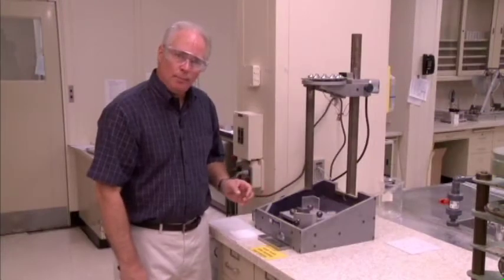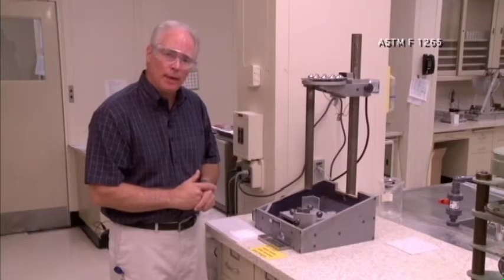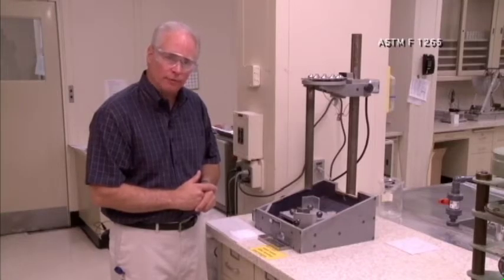This apparatus is an impact tester. It's actually an ASTM standard test method that's used in the vinyl composition tile specification for evaluating the impact resistance of resilient floor tile.